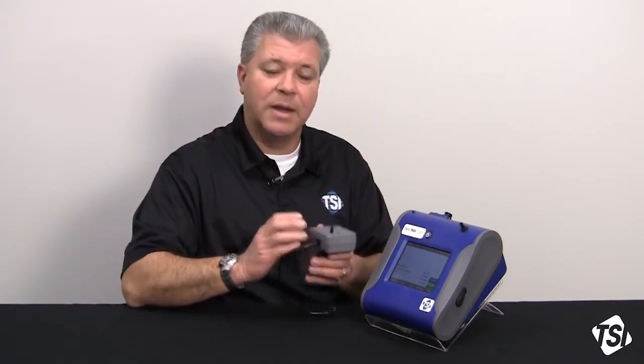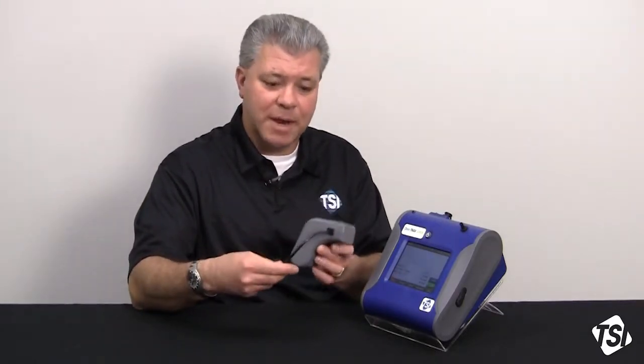As temperature conditions vary, and the same thing with humidity, you're zeroing out those effects with regularity so that your data will always be optimized for these longer sampling periods. Same thing for indoor air quality: temperature may change during the day or the evening, humidities may change, so you also want to make sure that you can utilize an Auto Zero module.